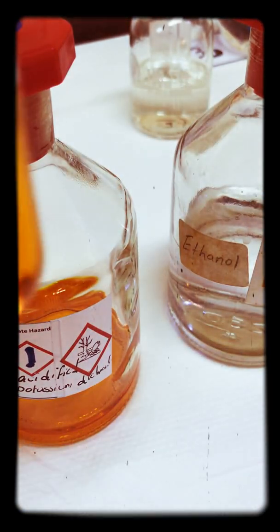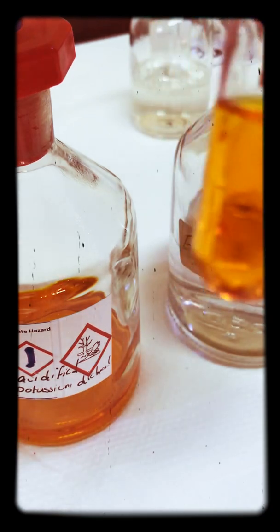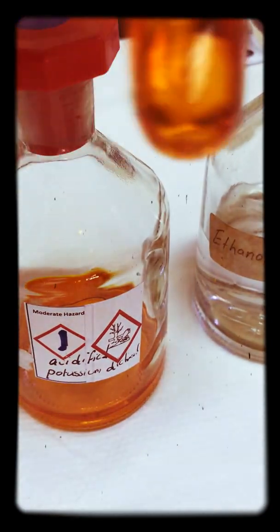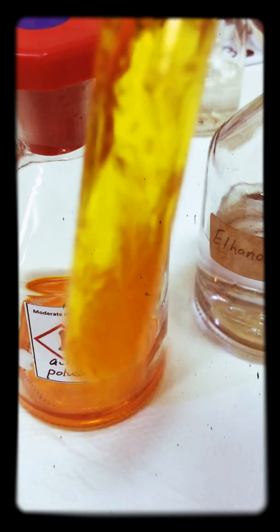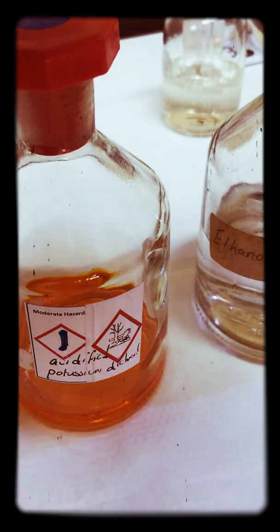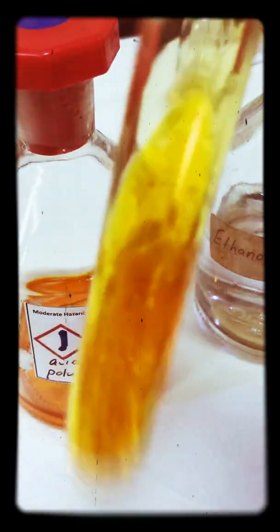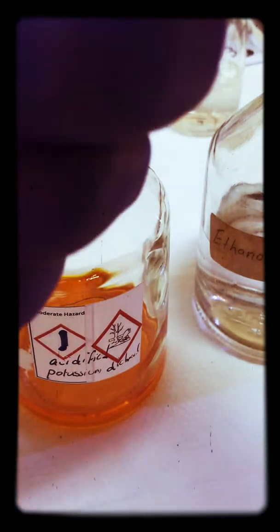So all I've done is I've added the acidified dichromate to this test tube and I've also added the ethanol, shaking it around. Now funnily enough, it does actually feel a little bit warm when you do it.